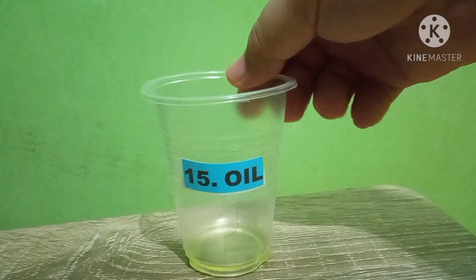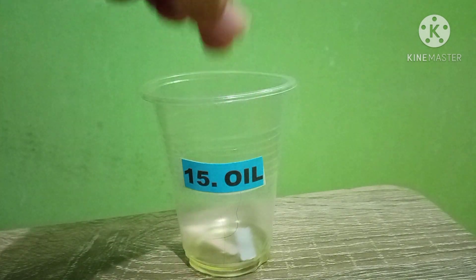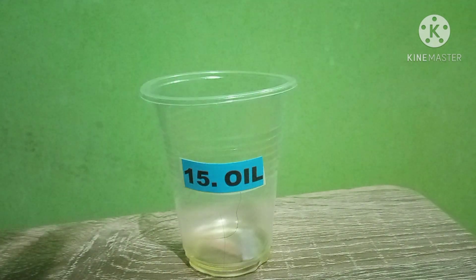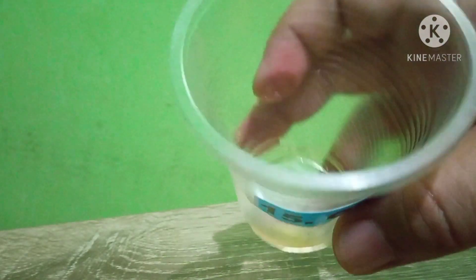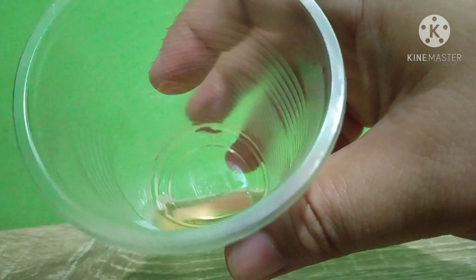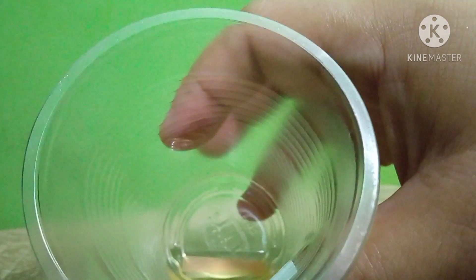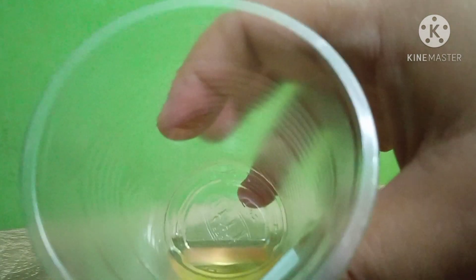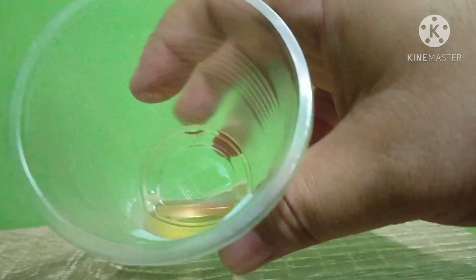Next is Oil. Let's dip the litmus papers. The red one is gradually turning blue — not totally blue, but slowly changing. So oil is basic.